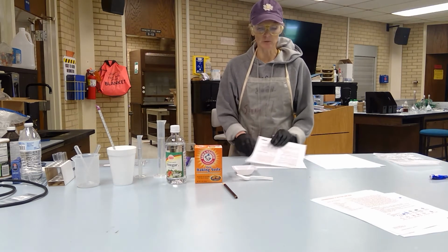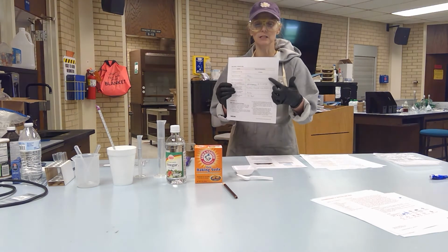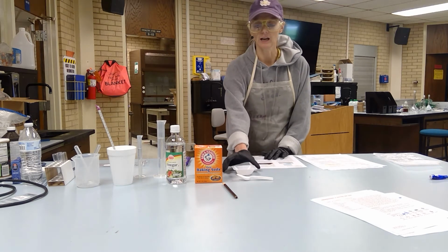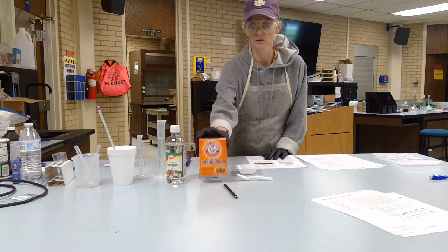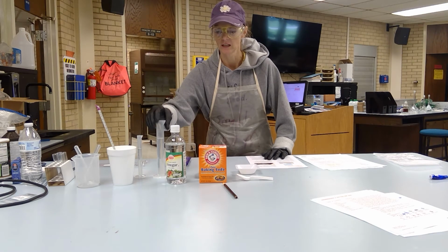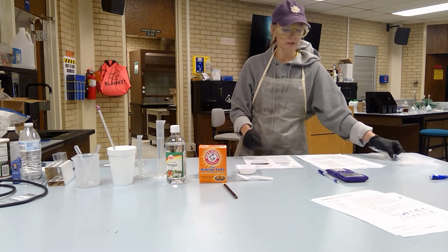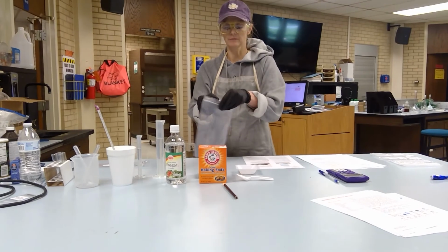Okay. Then in table 1, you will fill out the information that you need, and you see I've already pre-done that. So prior to completing the rest of this, I've gone ahead and I've already pre-weighed out my baking soda. I've already pre-measured my acetic acid, and I've already done all of my calculations. So in activity 1, I'm going to basically put together the reaction.